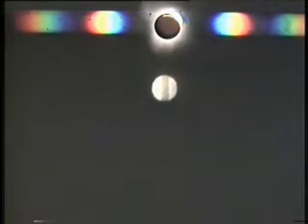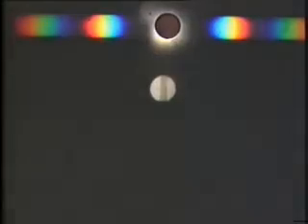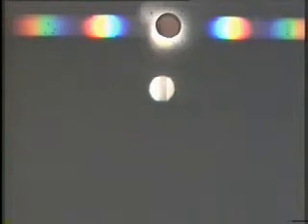order beam. What I'm now going to do is to put in a small stop, a small opaque blob there, which I can arrange to be concentric with the pinhole. So I can push this in like an eclipse of the moon or the sun, and I can block off the zero order light. Don't worry about that little reflection that you see at the bottom. It's troublesome. I don't know what the cause is. I've been trying for about 5 years to get rid of it. It's a reflection from in the system somewhere.